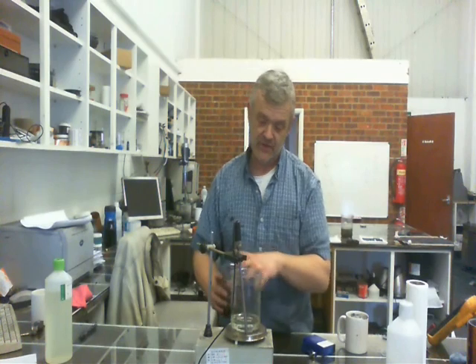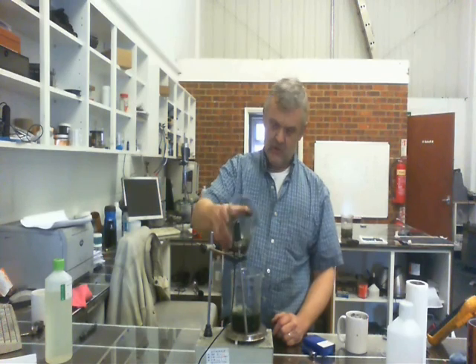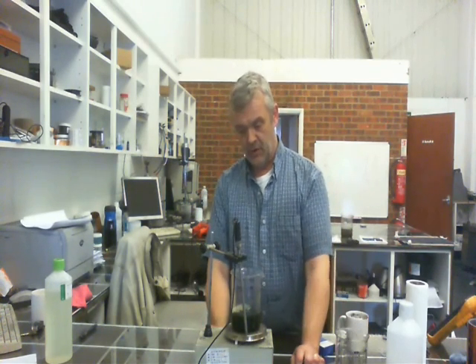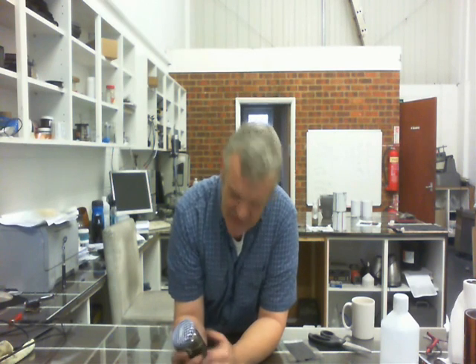I've made about 100 milliliters of this and I'm going to add 100 milliliters of my chlorophyll solution. I want to get that back down to 100 milliliters. I've turned the heat up to 95°C and I'm leaving it stirring until the volume has reduced to 100 milliliters, so I know the water has gone and all that's left is chlorophyll in deep eutectic solvent.